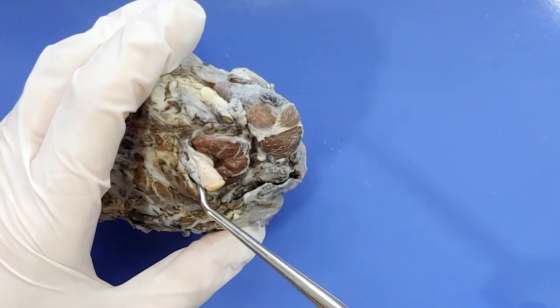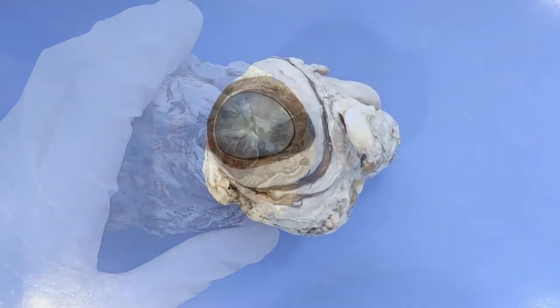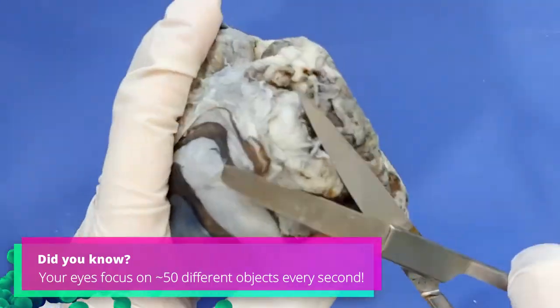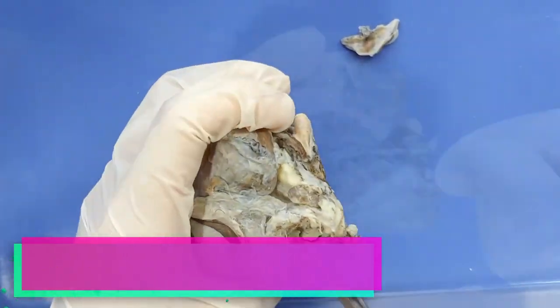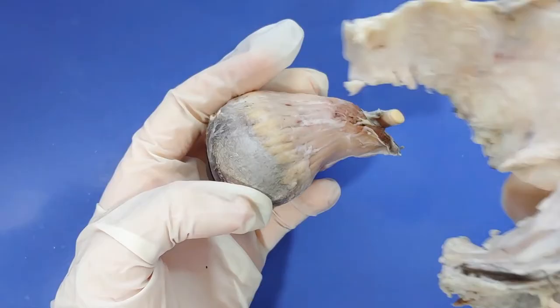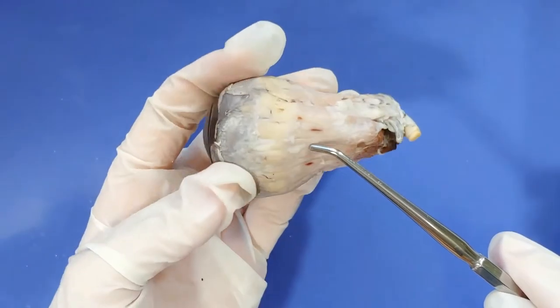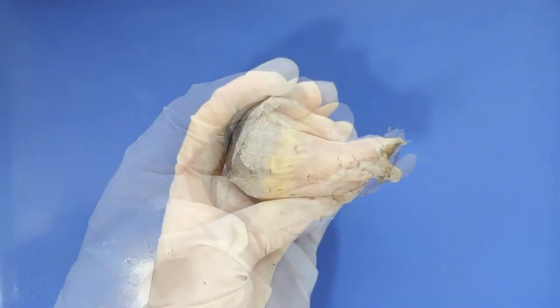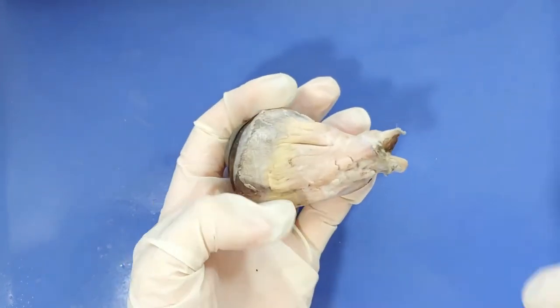When you cut all of this off, be careful to cut around this thing right here, which we'll discuss later. So now that I've removed the fat layer, we can get a better look at the muscles. So now I'm going to cut away the muscles too. Again, be careful to avoid this thing here.